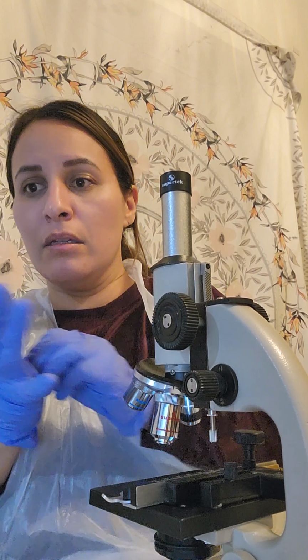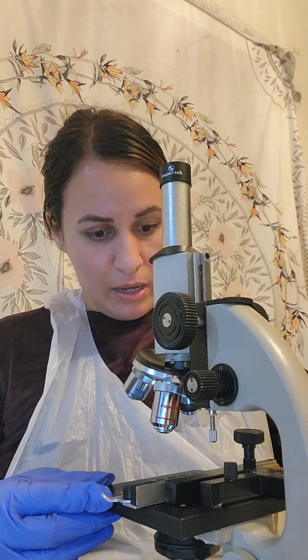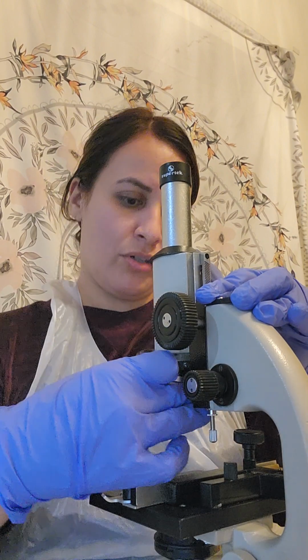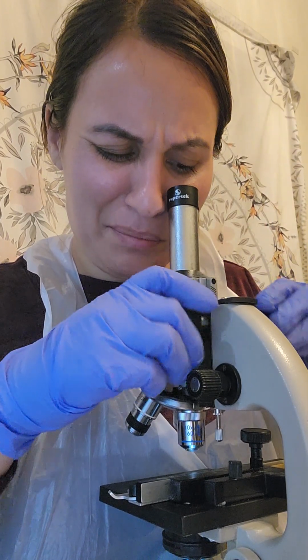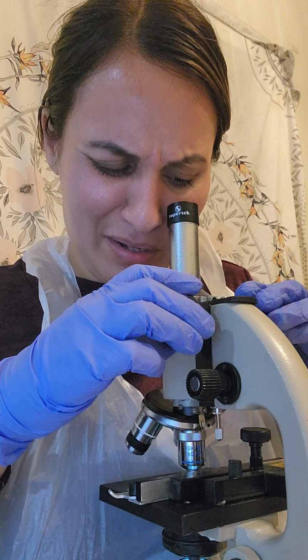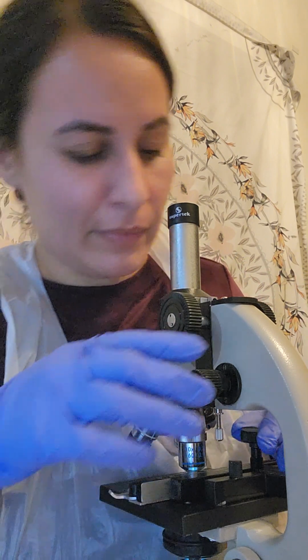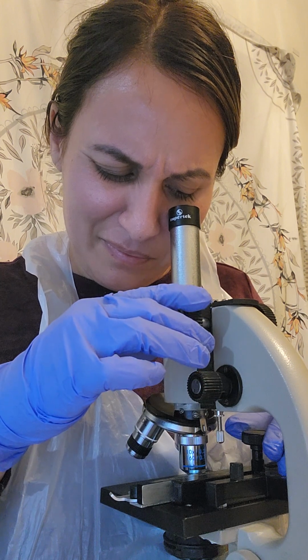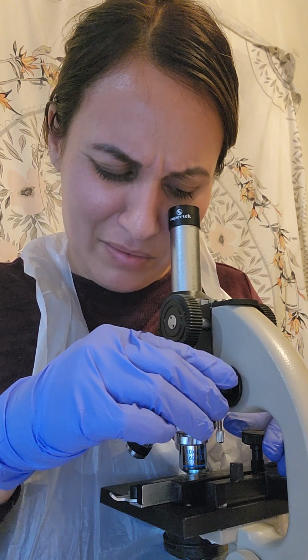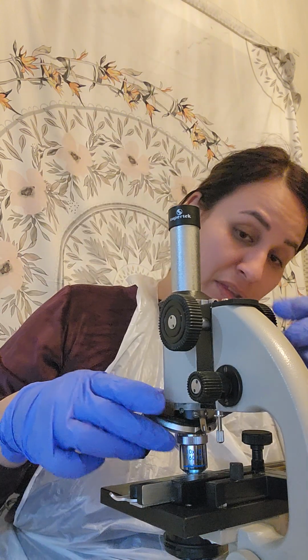Apply a drop of oil immersion oil on the specimen slide. Okay, so I'm going to get this up again. Now, I'm going to make sure with my lower powered lens that I have this pretty much in focus again, just so that way I can make sure I can see what I'm focusing on. Make sure that I'm in the right spot, is what I mean. Okay. So I am definitely on the E.